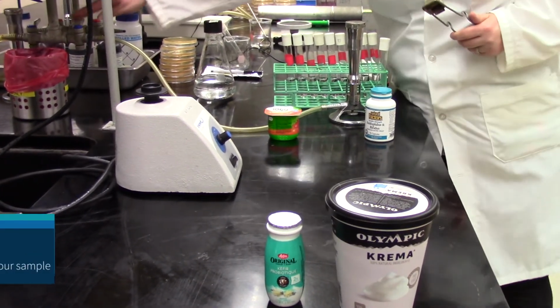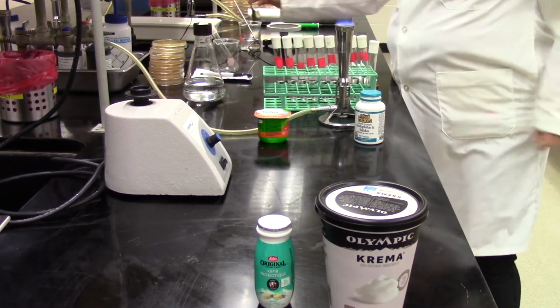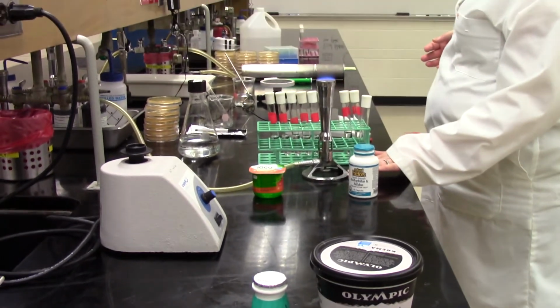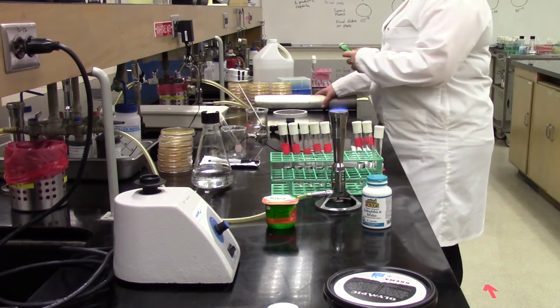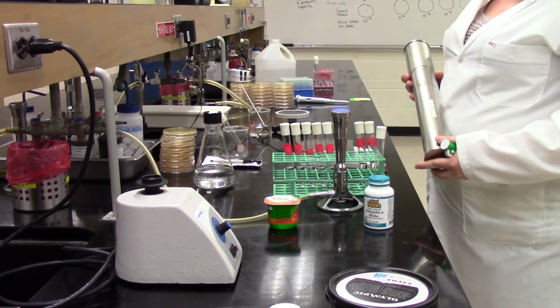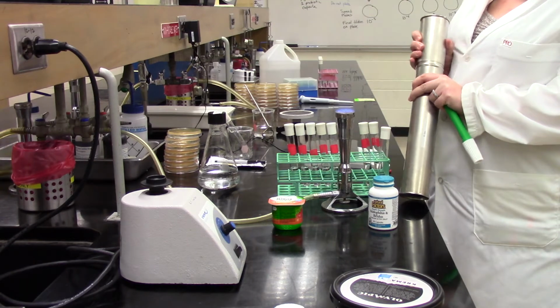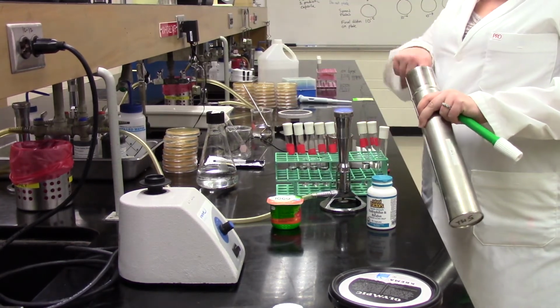So this is always a little bit of a funny thing, because you obviously eat yogurt at home not using proper aseptic technique, but remember that we want to prevent other unwanted microbes from the environment getting into the samples we prepare, because that's going to confuse our experimental results when we're finally trying to enumerate these cultures. So Sabrina is going to work with the capsule using good aseptic technique.